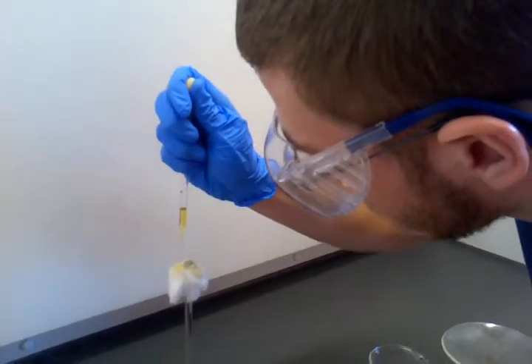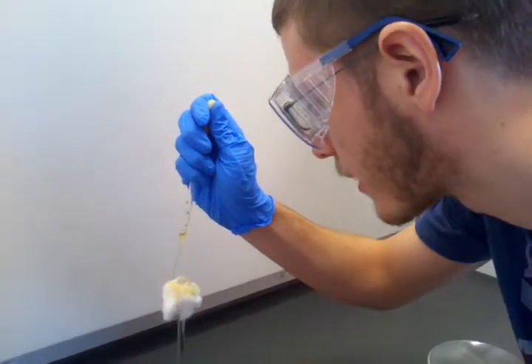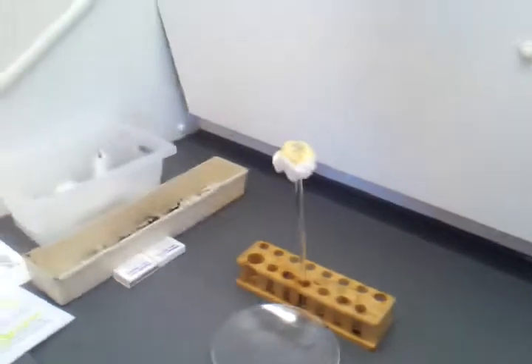So we have plenty of product to burn. I think that's a good amount. We covered the whole pot. I'm just going to make sure I don't have any oil on my hands. And we have to record for how long it burns.